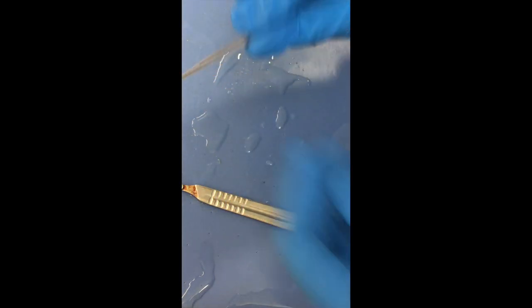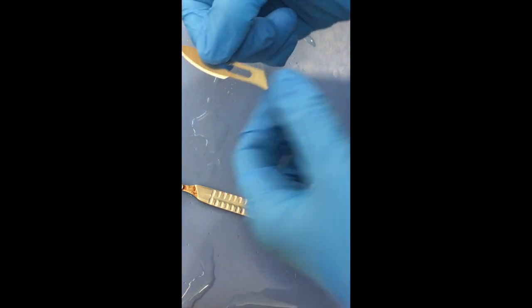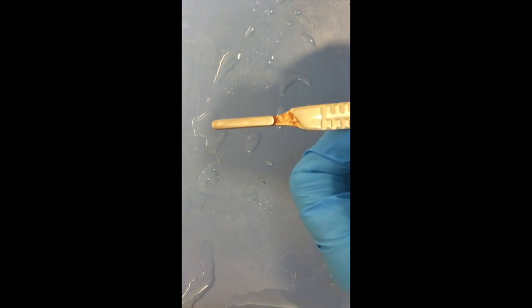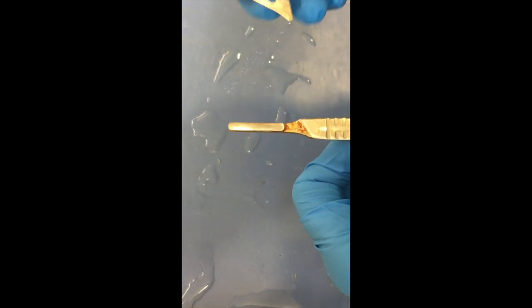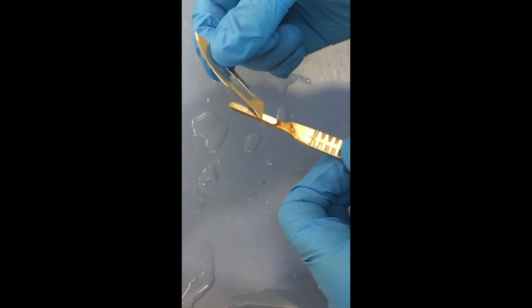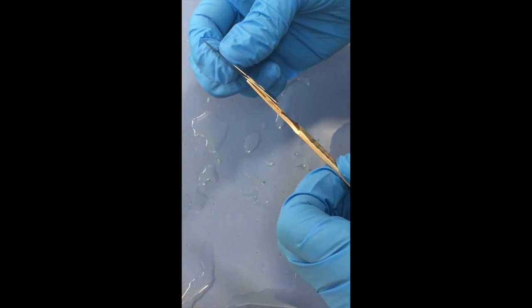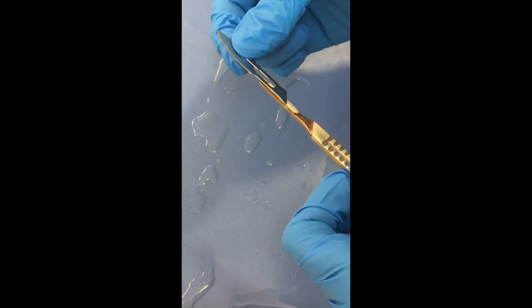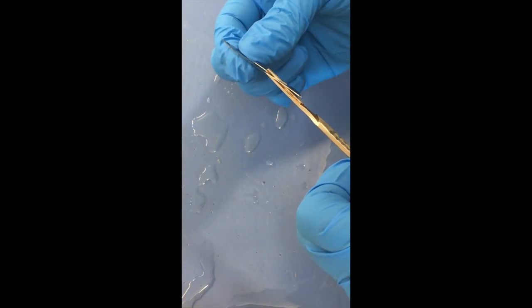So here, if you notice, when you take a scalpel blade out, it's got this angle here and it matches up with the angle that you see right there. And so then when you place it on, you see that this opening that's in the blade, you slide that over but only kind of partially.